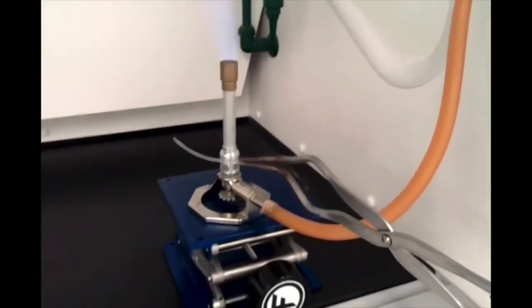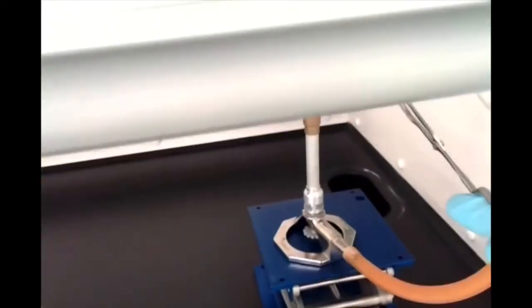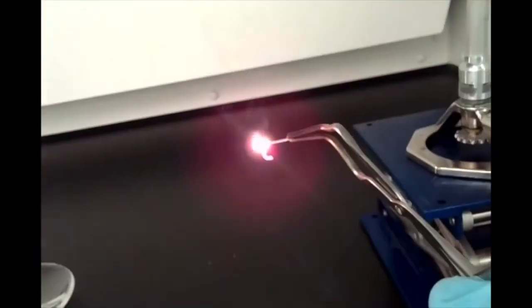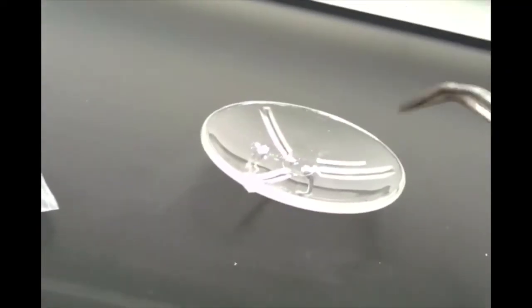All right. So normally you would look away or use your peripheral vision to look at the magnesium as it burns, but instead, well, see it now. So I'm going to do that here so you can see it. There it goes. So notice the bright white light as well as the white smoke that's given off. And then also, look at the white ash that's being produced.